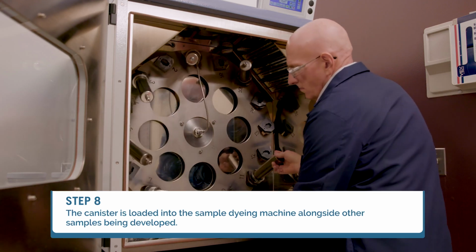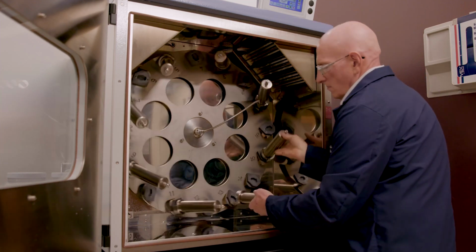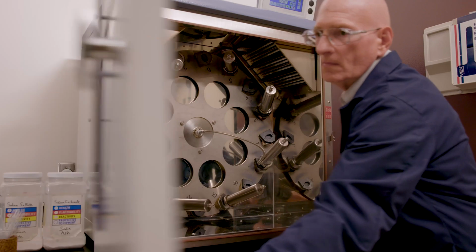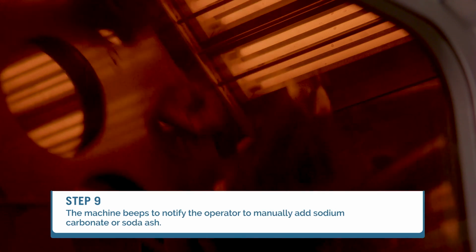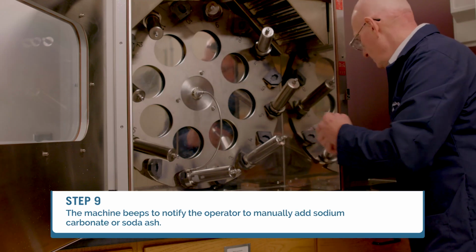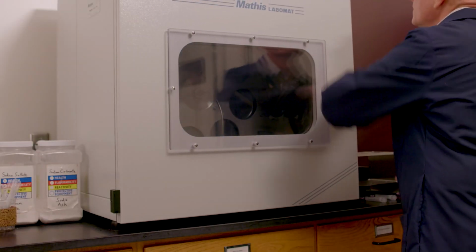The machine replicates the full-scale production dyeing procedure for the specific dyes being used. However, some adjustments may be made during production when the formula is scaled up. As the correct dyeing temperature is reached, the machine beeps to notify the operator to manually add sodium carbonate or soda ash. The soda ash must be dosed over a period of time to ensure level fixation of dyestuffs.